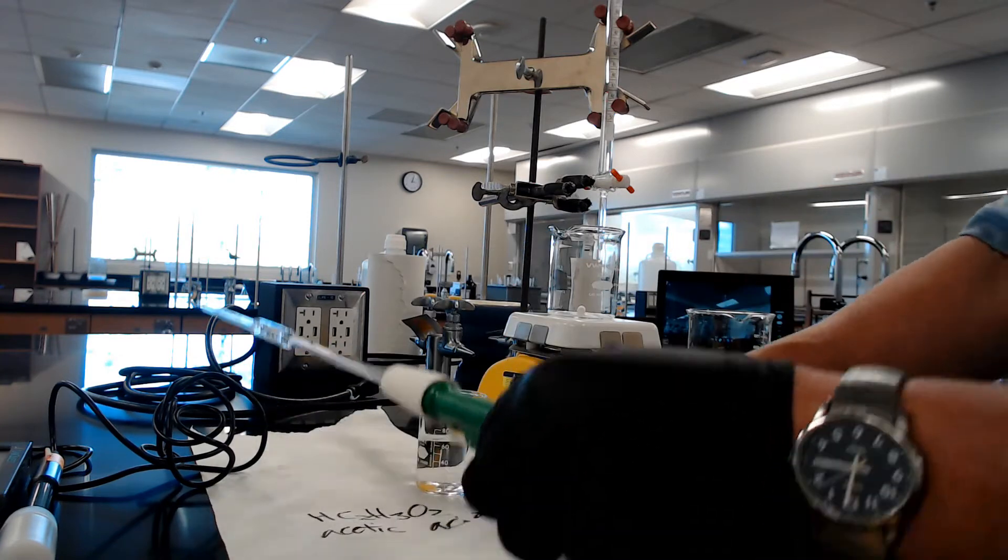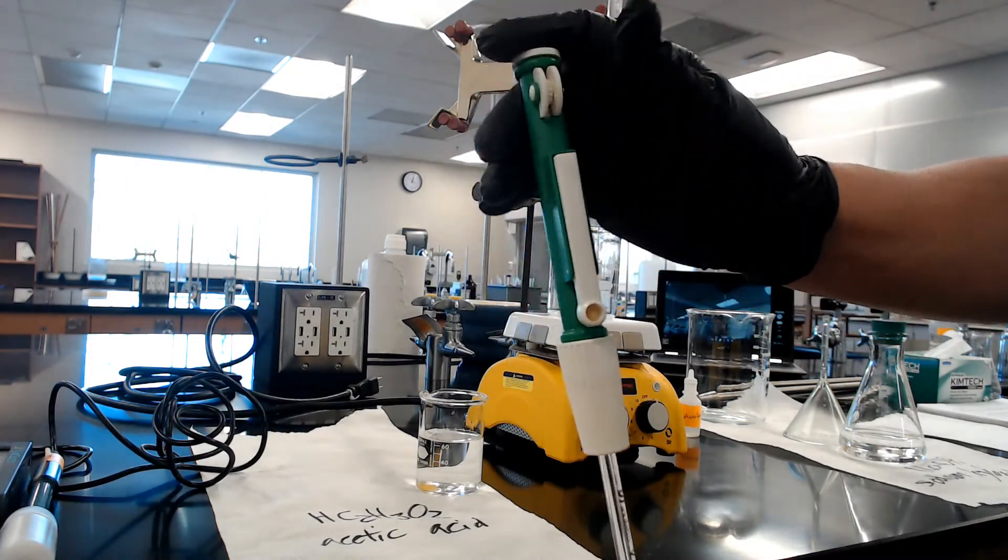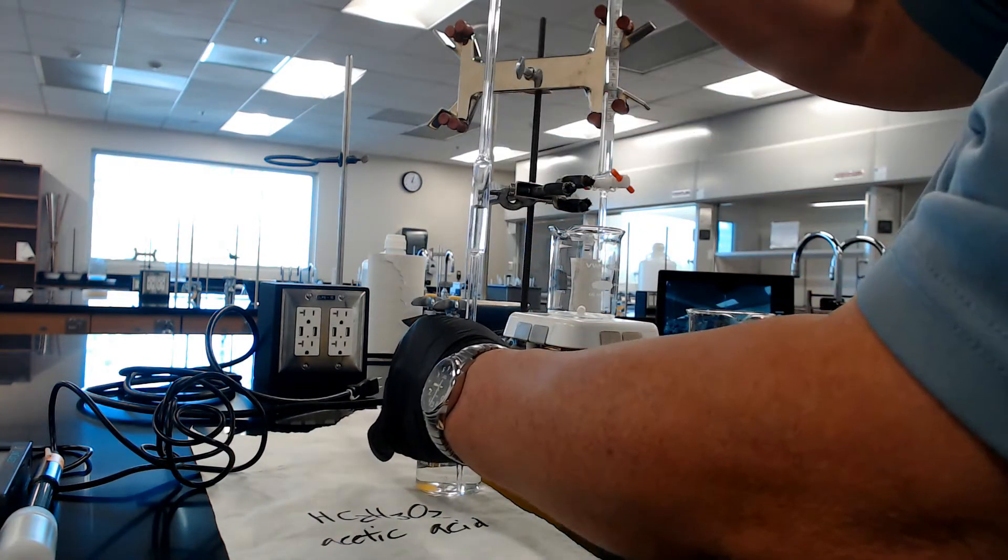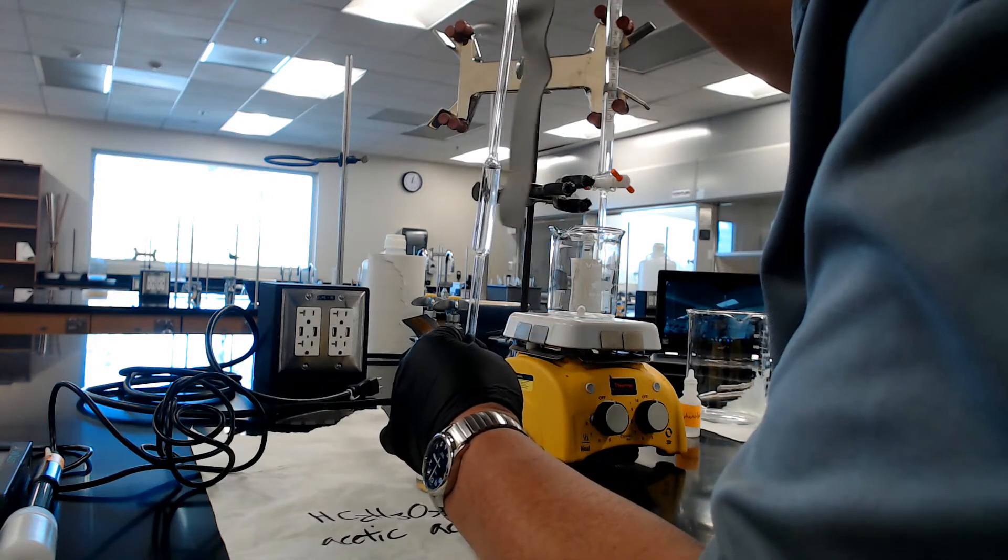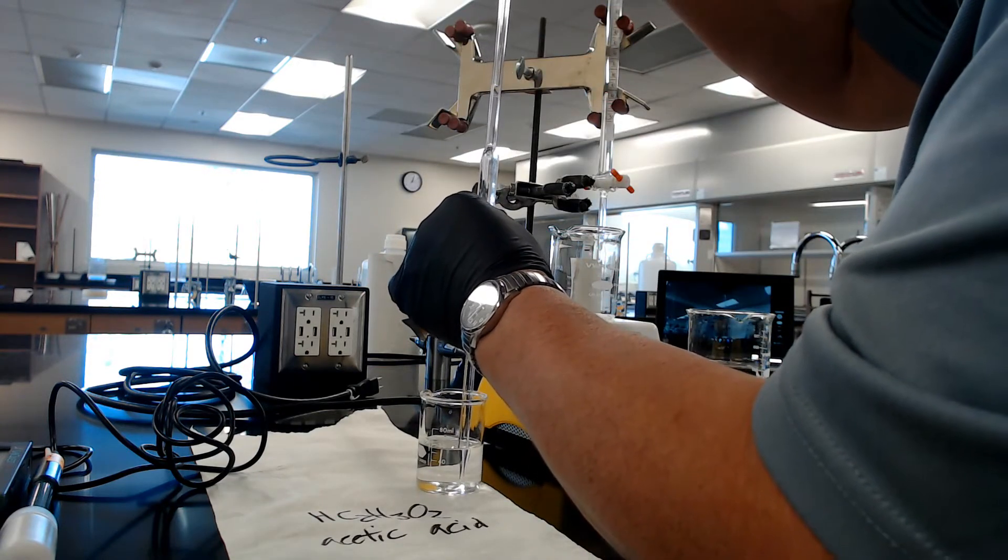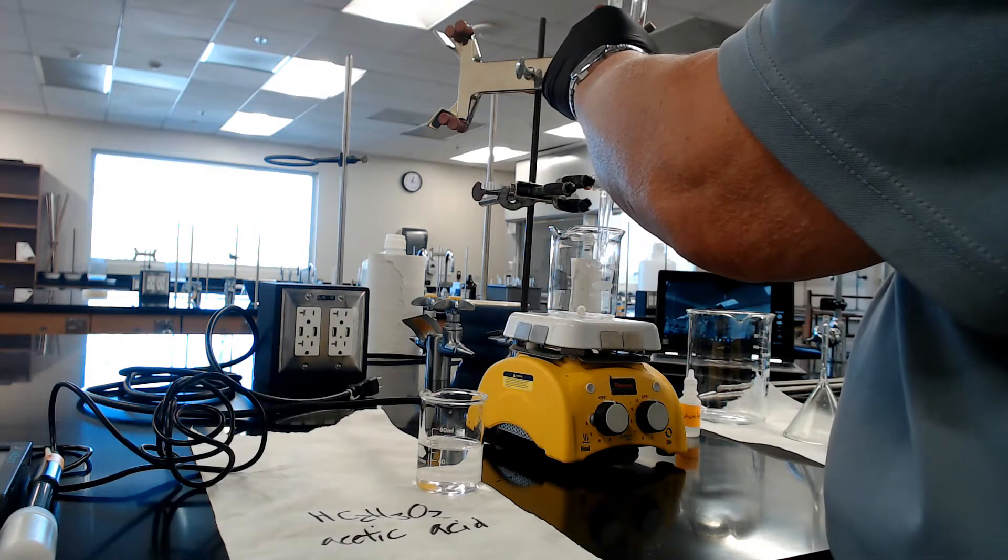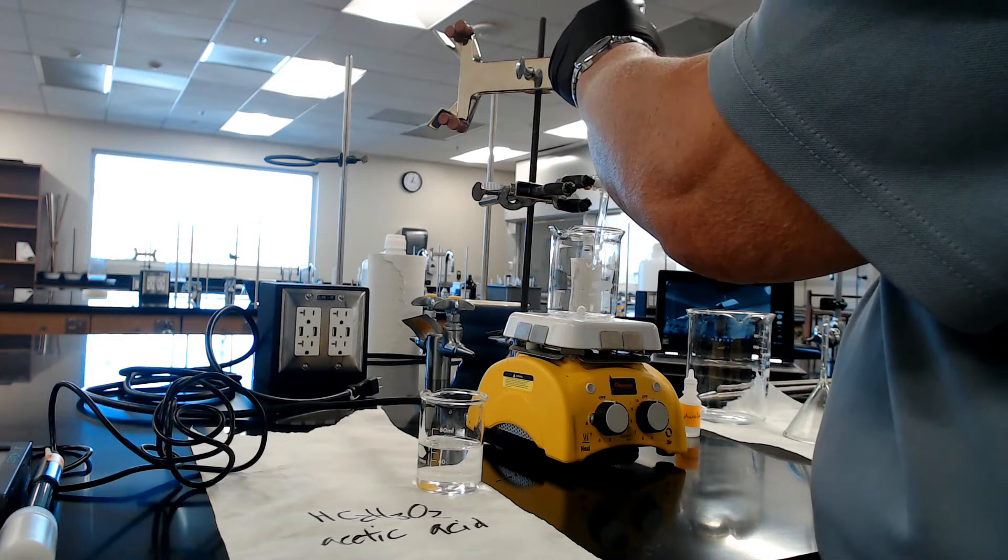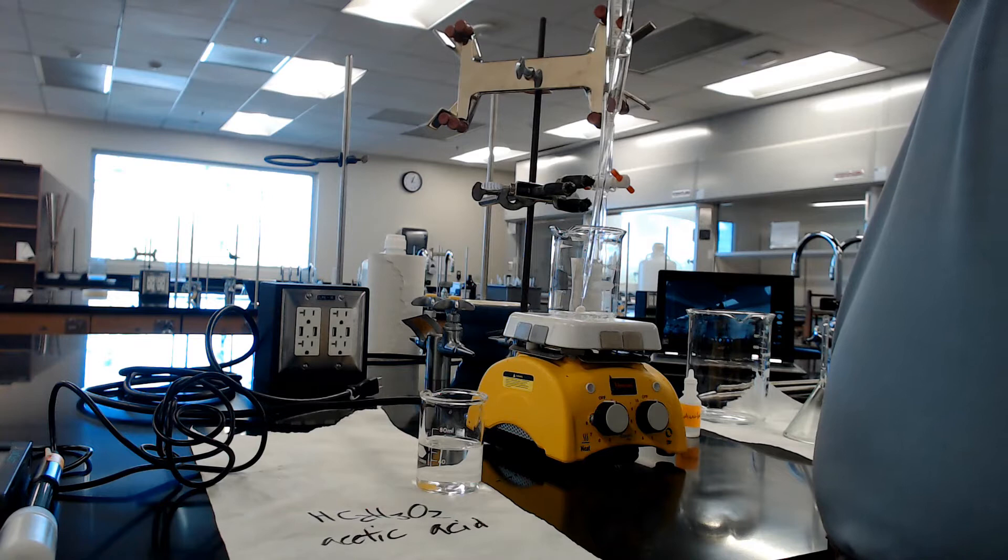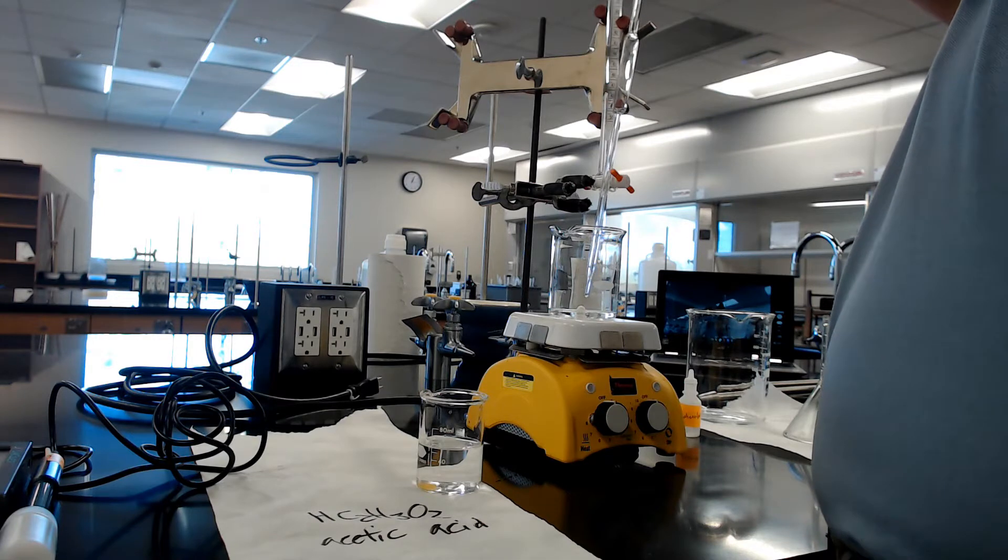Second thing, pump up. This is for drawing the liquid up, this is for dispensing, this is for purging. I've already rinsed it. Draw the acetic acid. Be careful with this one because even though it's a weak acid, if you touch the tip to your arm, it's going to blister. How did I know that? Done that. Here we go, dispense. The thing is clogged, just give it some patience. There it goes. There is 10 milliliters.